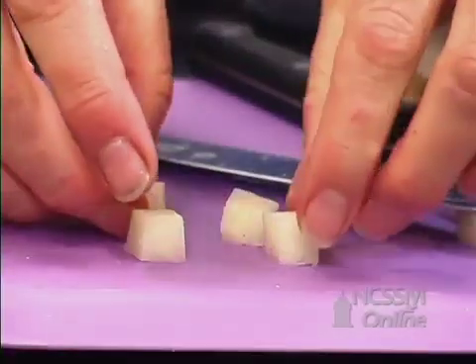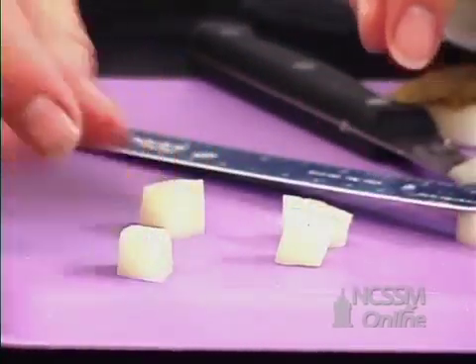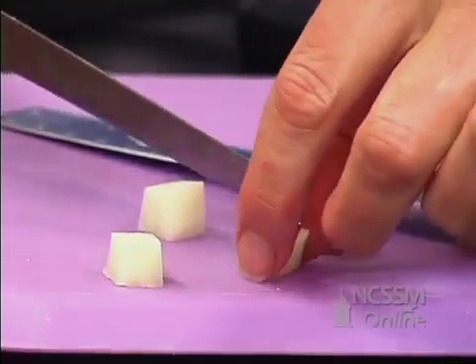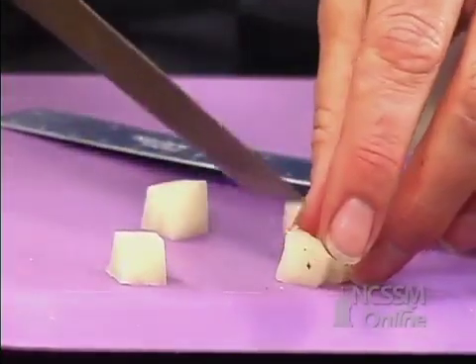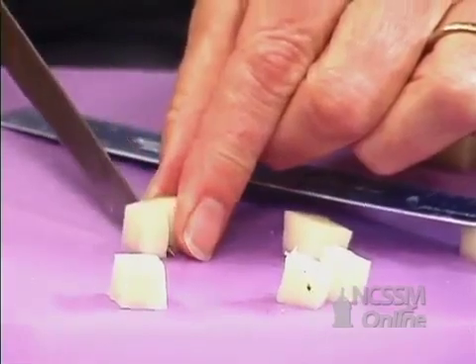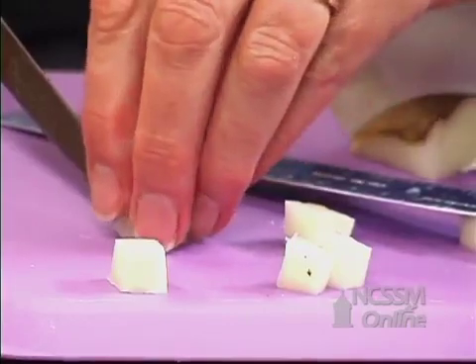I have cut four one centimeter cubed pieces of potato. In one we're going to have just that surface area. In two I'm going to cut them in half, so this one will have more surface area. And this one I'm going to cut in fourths, so we're increasing the surface area.